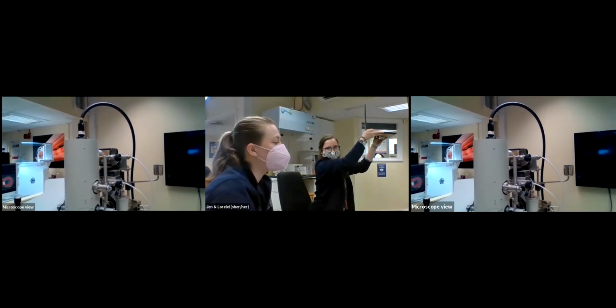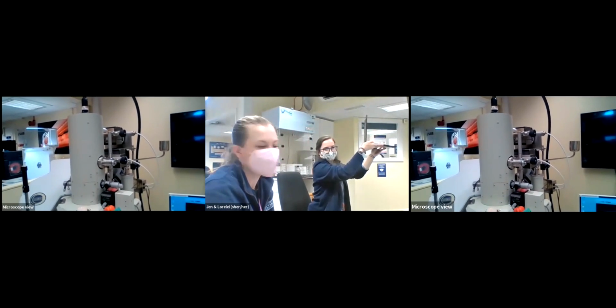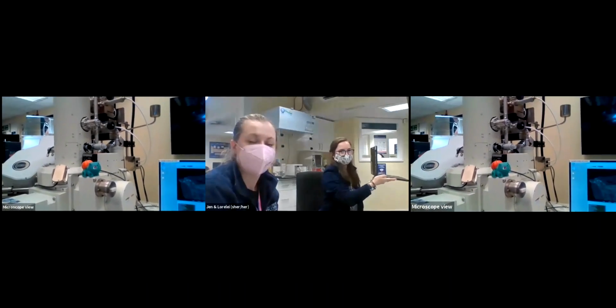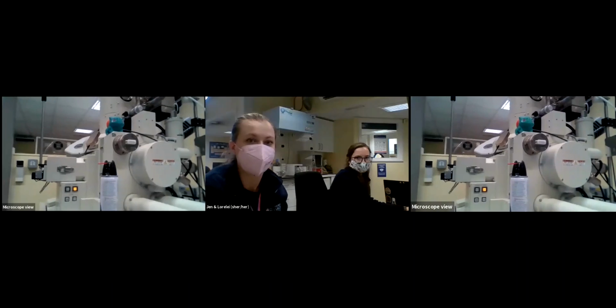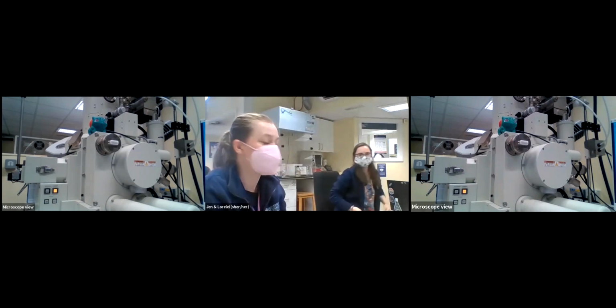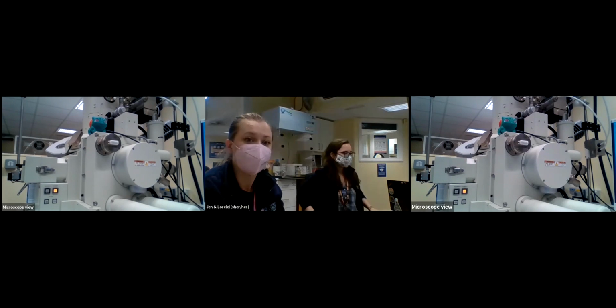So what we're doing is using about, I think we're on 15,000 volts today. And we're basically electrocuting a rock. What that does is that electron beam comes down, it interacts with the sample at a really good vacuum. So we've got no oxygen in there rattling around either. And it will excite the atoms at the top of the sample surface. They will then release electrons.